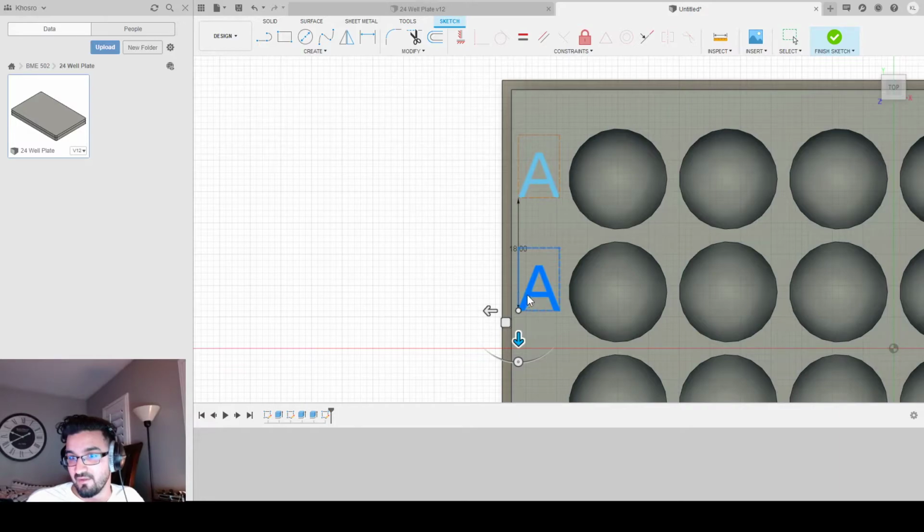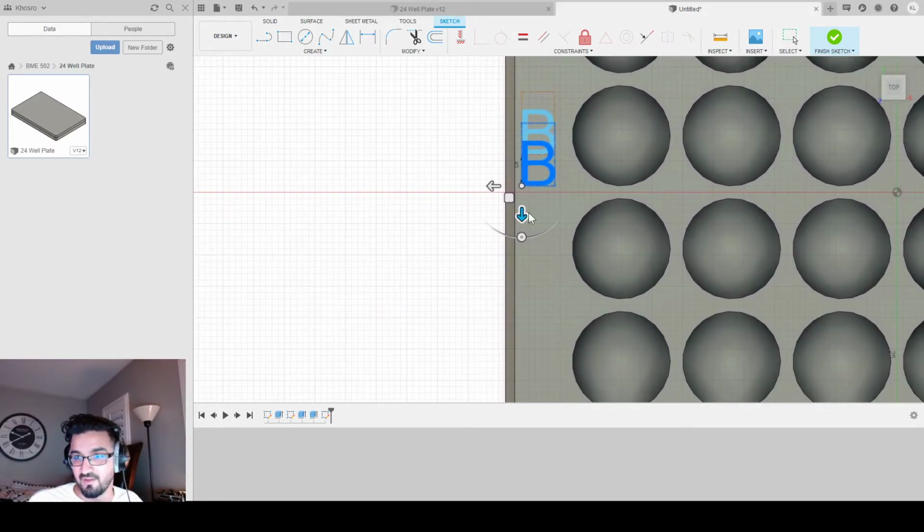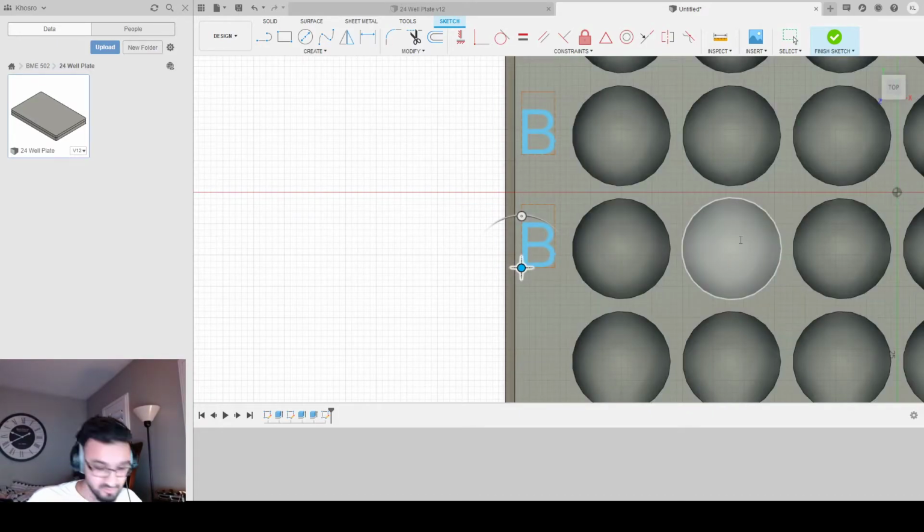And we're going to hit OK. That's where I want it. Now, if I double click on it, I could change the letter to B. Voila. Now, if I select it, copy paste again, I could drag down another 18, and I'm in the center point of my next circle. I'm gonna click OK, double click, and change this to C.